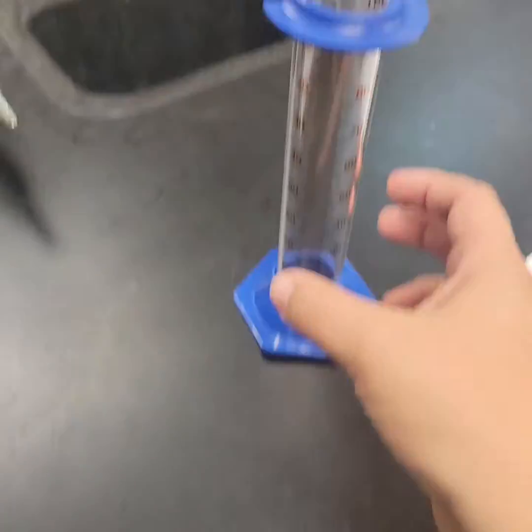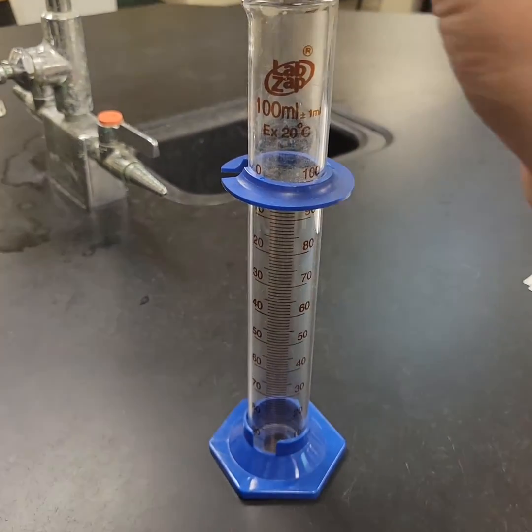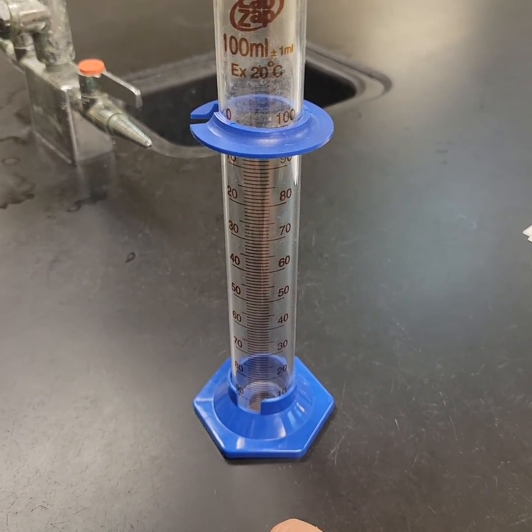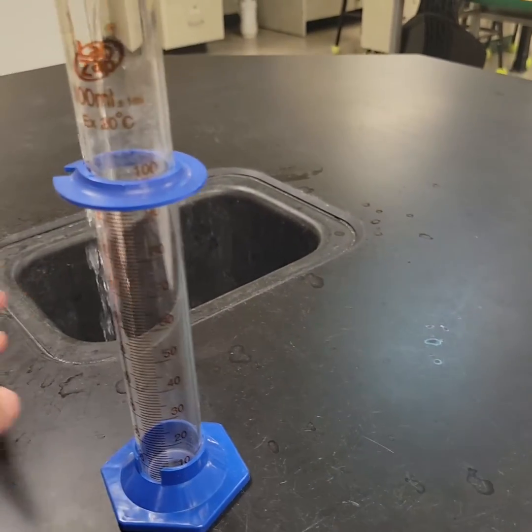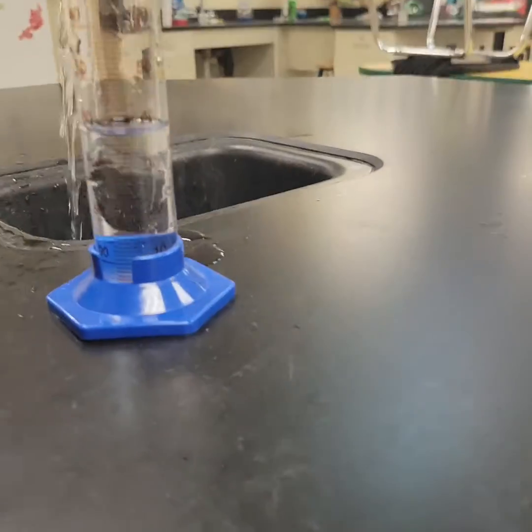Once you've done that, we're going to take the graduated cylinder. I am begging you, do not drop the cube in my graduated cylinder. You will break the bottom of my graduated cylinder. It is glass. So the first thing we're going to do is fill this up with water, to any amount, does not matter.